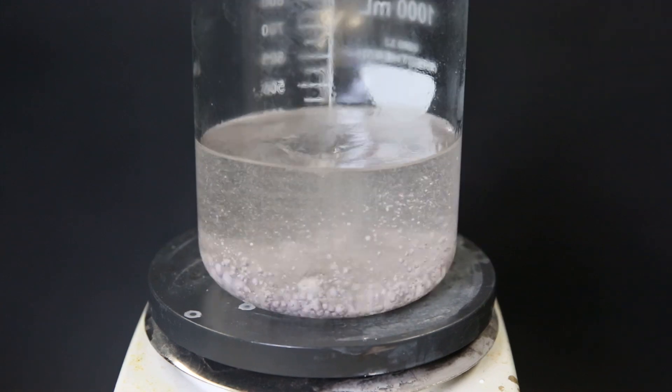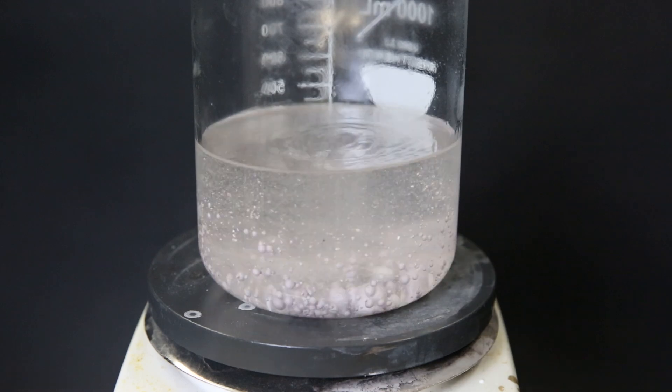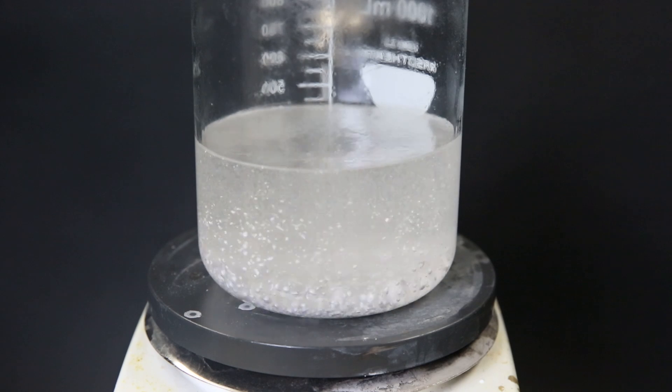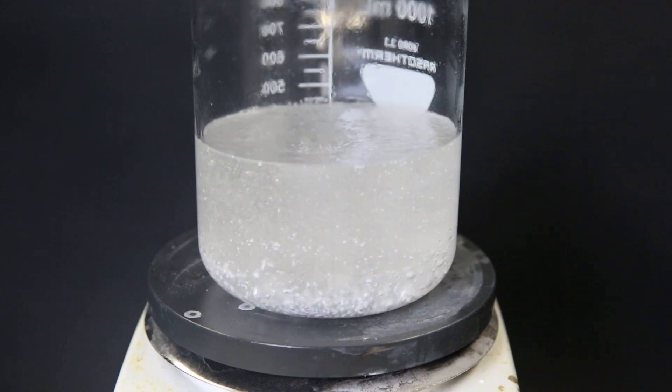I put it in a stir bar and bring the toluene to a boil. Then I occasionally squirt in some isopropyl alcohol which will remove the oxidation from the sodium and allow them to coalesce into one big bead.